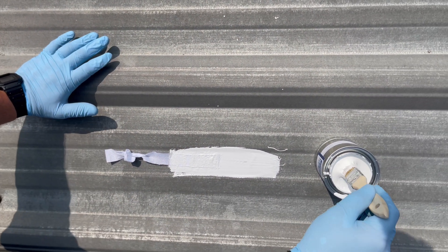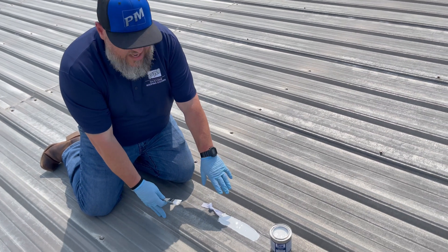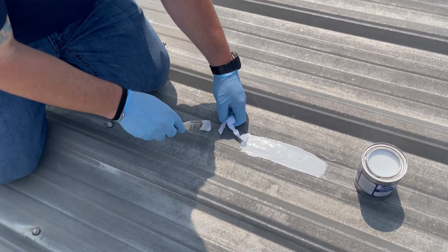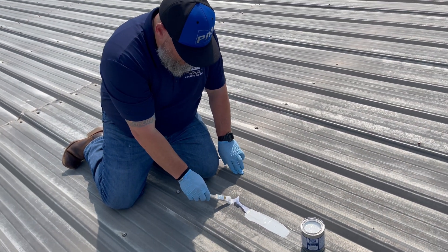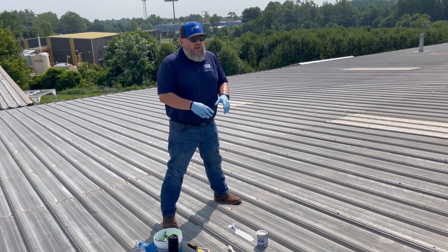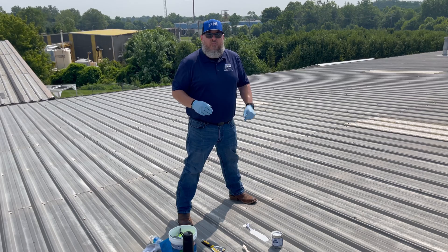Once you have it like that, add a little more material on top. If you do exactly what you did the first time on the bottom coat, on the top coat, you are doing it correctly. Now that we have our base layer, our fabric, and our top layer applied, I like to dip the tip of my brush, let it kind of fall, and put a dab right over here. I'm going to take this tail and just stick it in there. What that's going to do is stop this fabric on a windy day from pulling your test before you're ready to pull it. Now that we have the pull test applied, we're going to wait 24 hours. Sometimes you may need to wait a little longer if you're in a drier climate. Here in southern Indiana we have a lot of humidity, so this is going to cure just fine in 24 hours. We'll see you tomorrow.